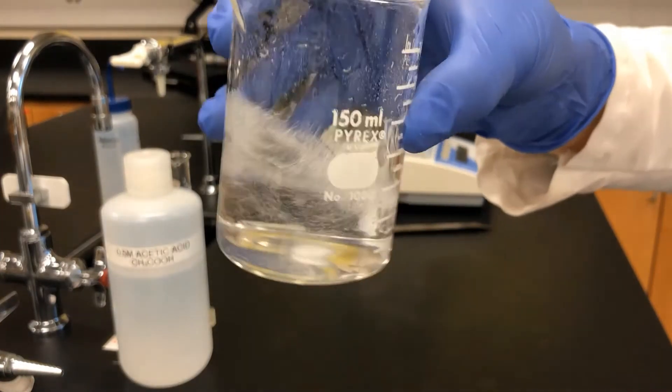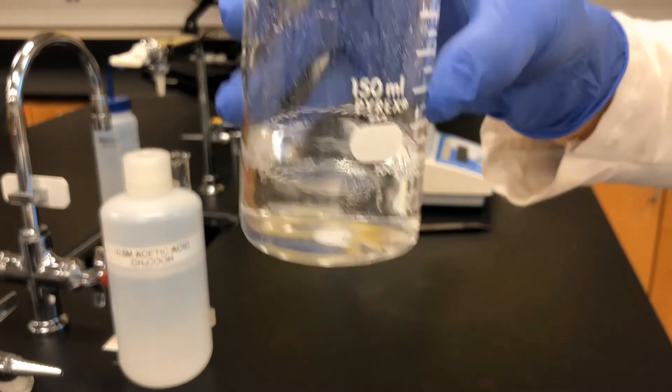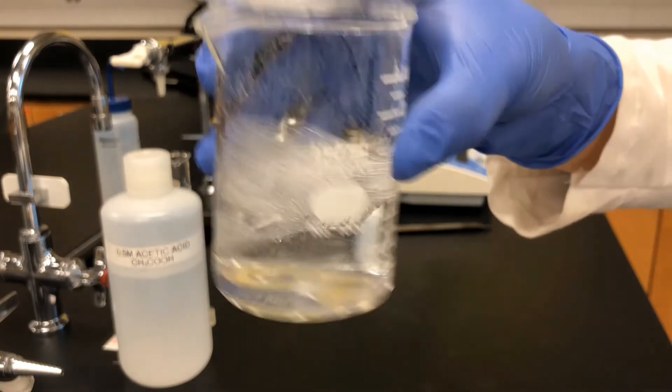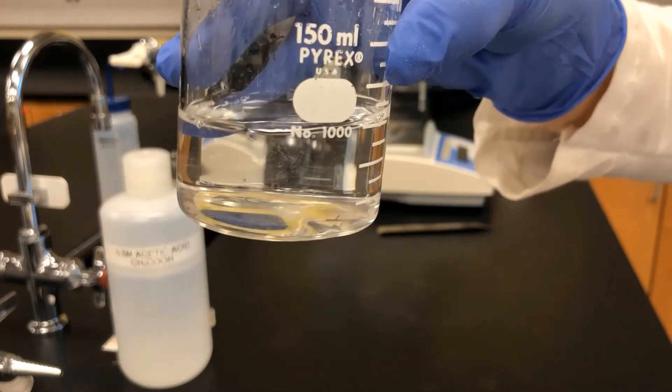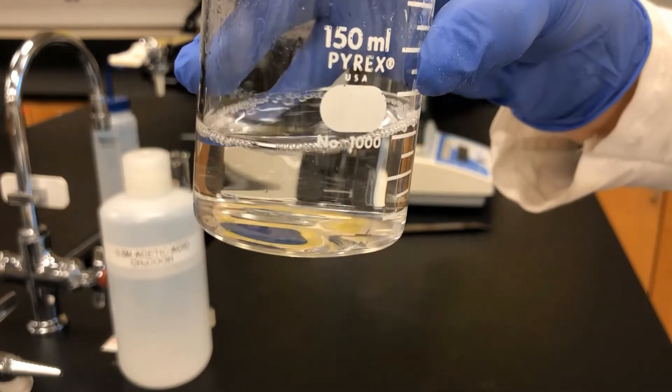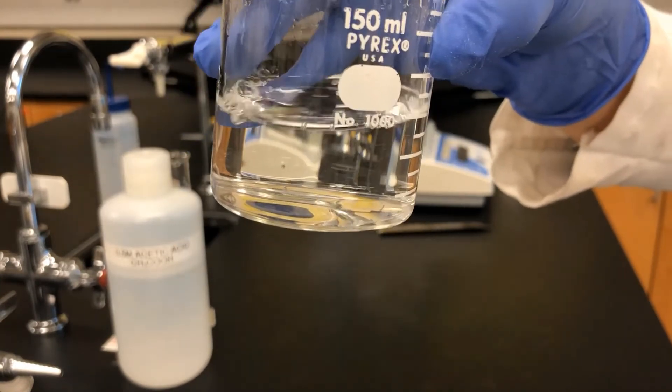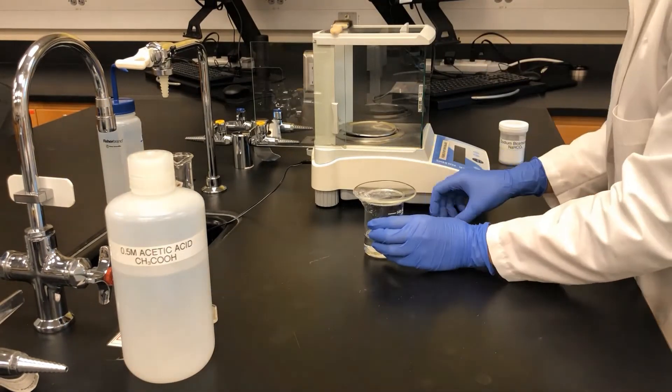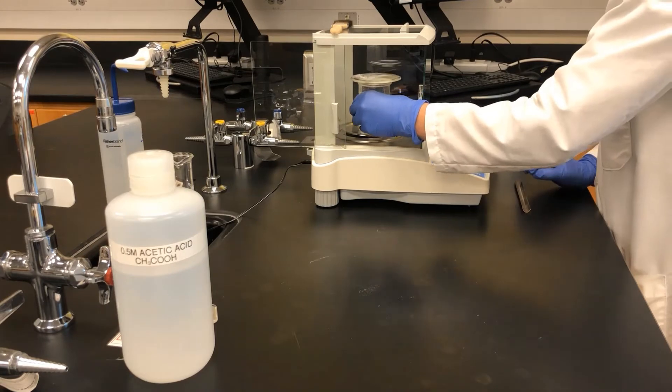It is important that all of the sodium bicarbonate reacts with acetic acid. When no more bubbles form, the chemical reaction is finished. The experimental setup is once again placed on the balance and the mass is measured.